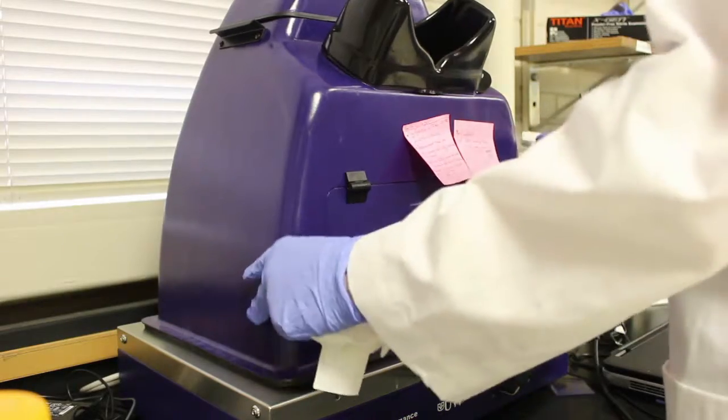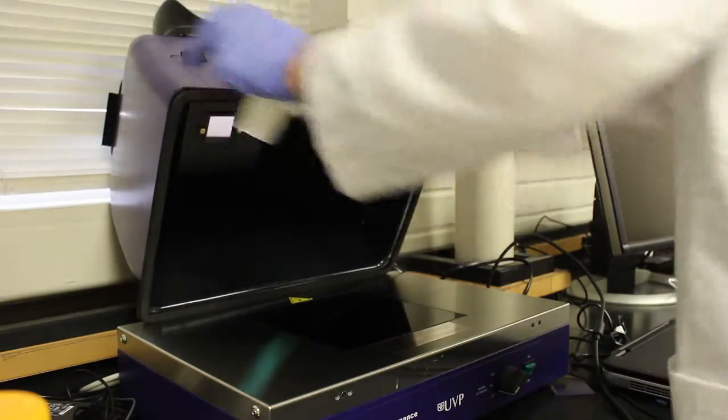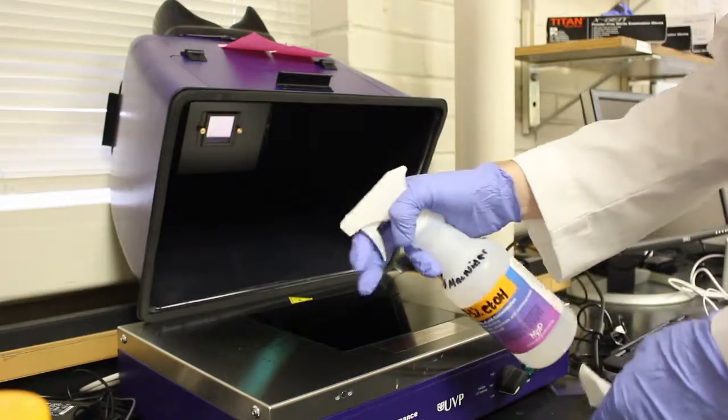Before imaging the gel, clean the surface of the ultraviolet emitter with an ethanol solution. This will ensure a cleaner image.